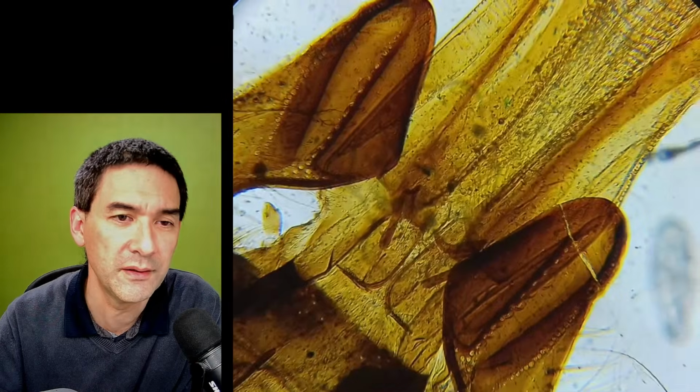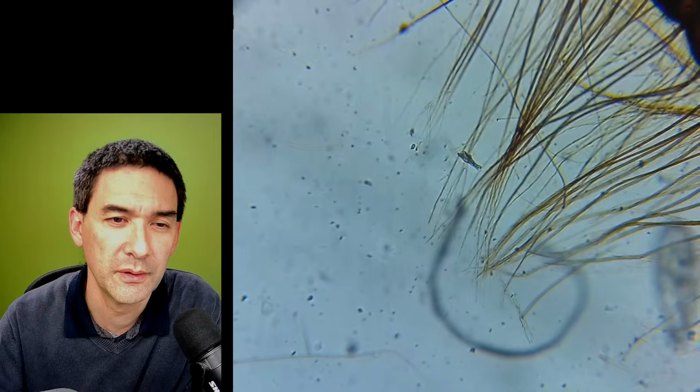Now basically the camera always adjusts the exposure. And another thing that I just want to show you here, and that's actually quite a nice demonstration. This microscope has no condenser, and it has no Köhler illumination. So you see that on the corner, right on the bottom.